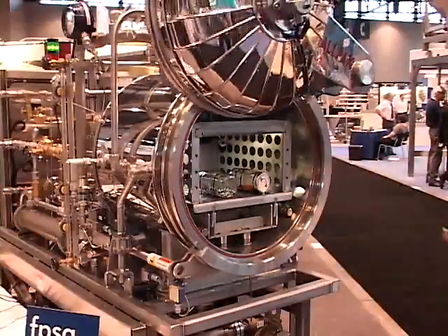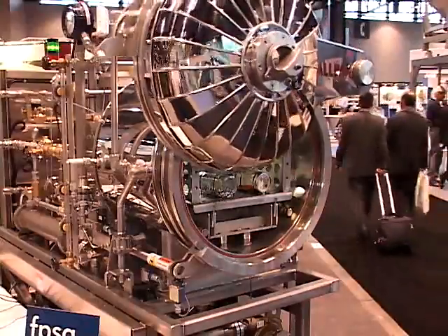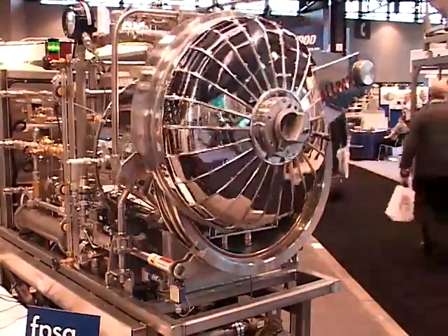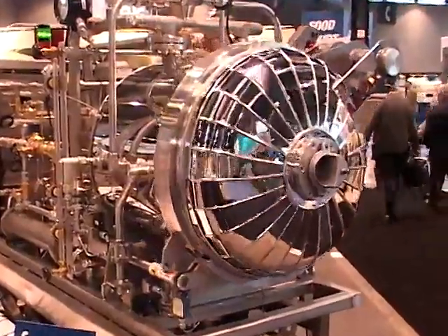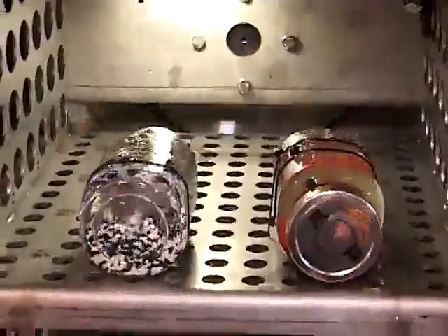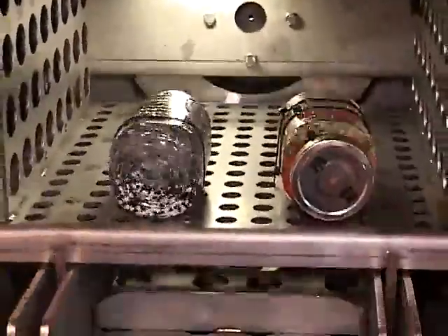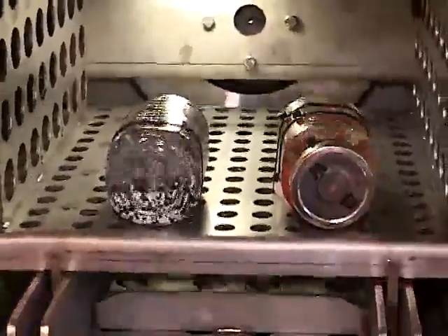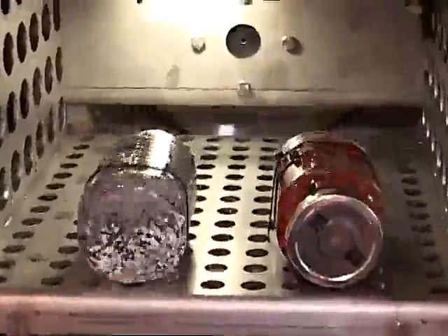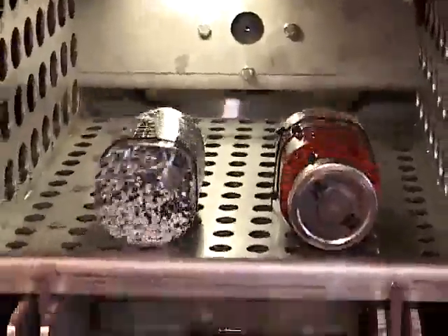The Allpax 2402 Flex R&D machine comes with our standard Allpax orbiting space-saving door. The 2402 Flex Retort has an agitation mode called Gentle Motion, in which plants can use this to agitate either pouches or containers laid horizontally to get faster process times.